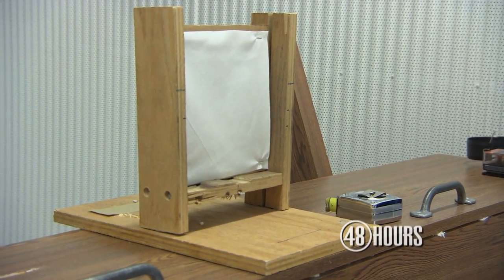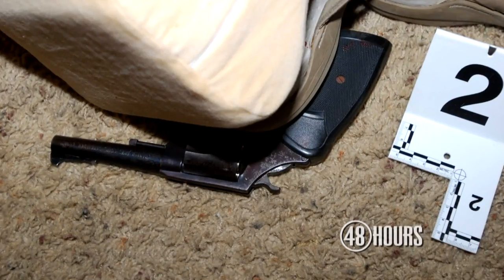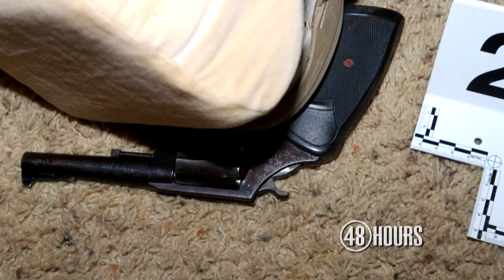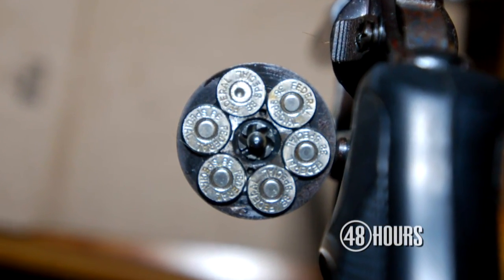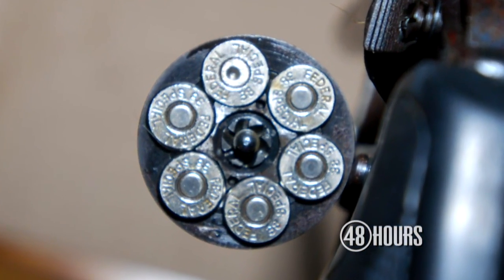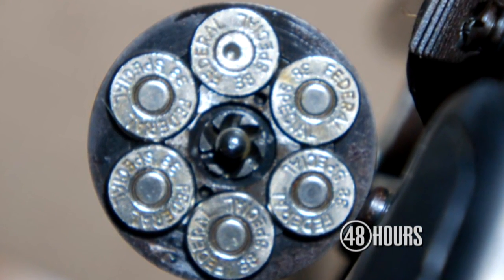What's the difference between suspect ammunition and lab ammunition? There was ammunition that was submitted with the suspect revolver — this is ammunition that was actually removed from the cylinder of the revolver at the time. We need to test fire laboratory ammunition along with the suspect ammunition because the ammunition that's used has a great effect on the residues that are left on the surface. So it's a matter of reproducibility.